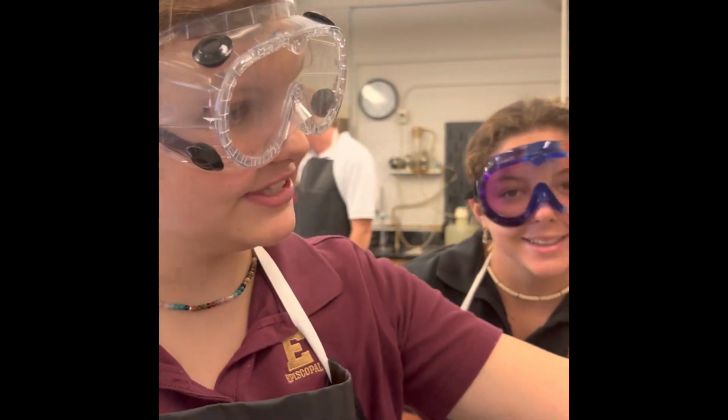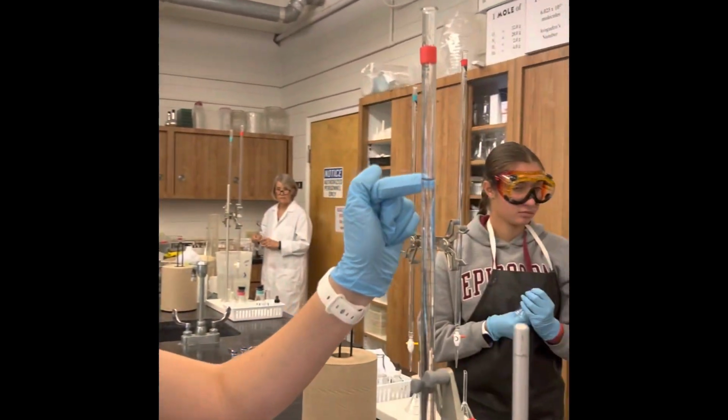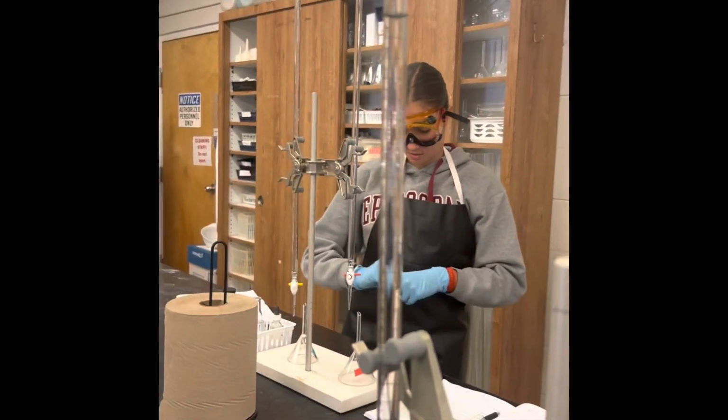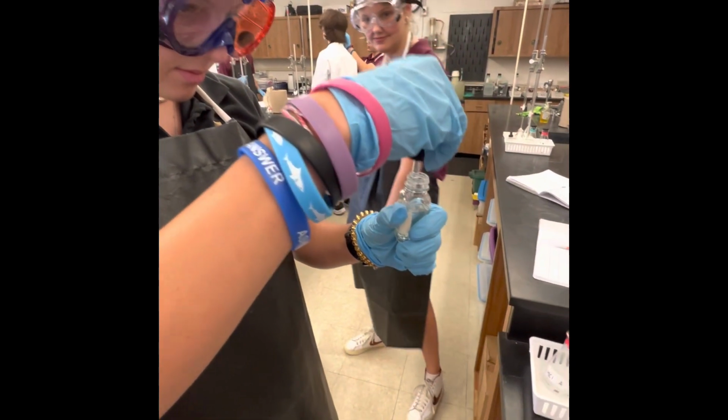The initial volume in trial 1 was recorded at 0.00 milliliters, and then 8.00 milliliters was released into the flask to make the final volume for trial 1. So we're releasing the acid 8 milliliters down, going from 8 to 16, and that's the acid we're going to use. The initial volume was subtracted from the final volume to find the exact volume to the nearest 0.01. Then 3 drops of phenolphthalein indicator were added to the flask. Adding the phenolphthalein for the 3rd trial.